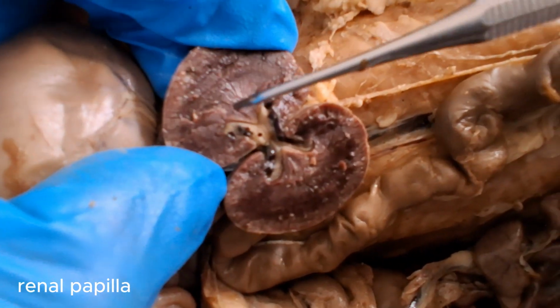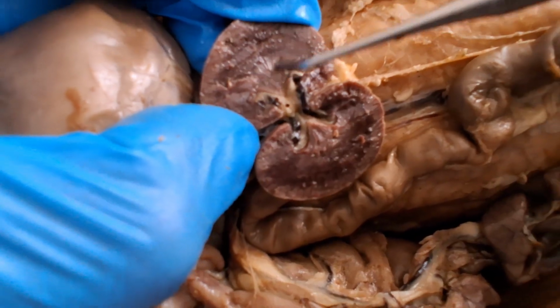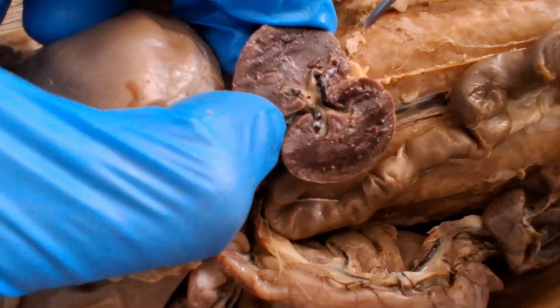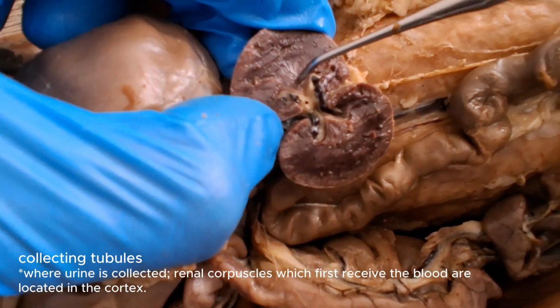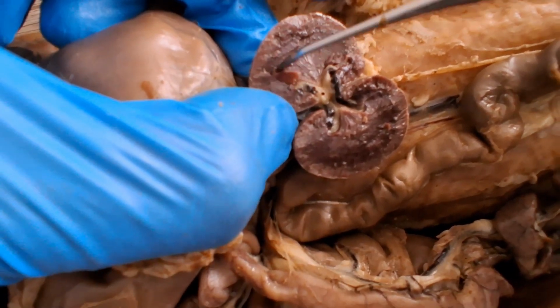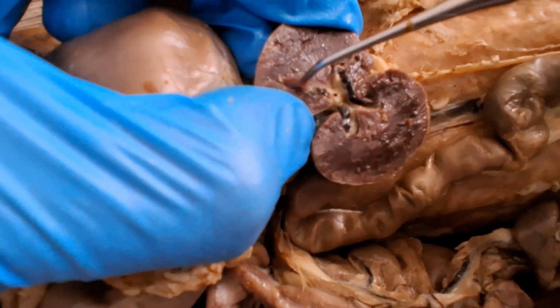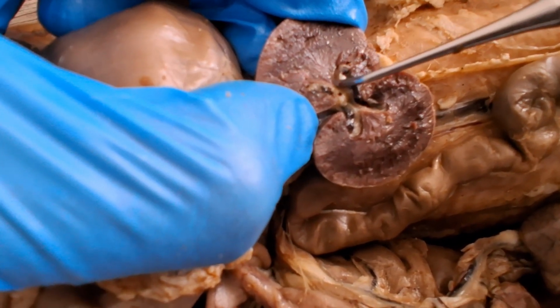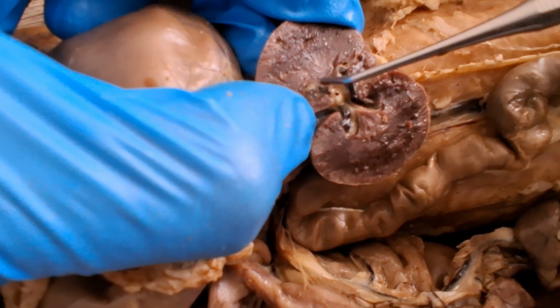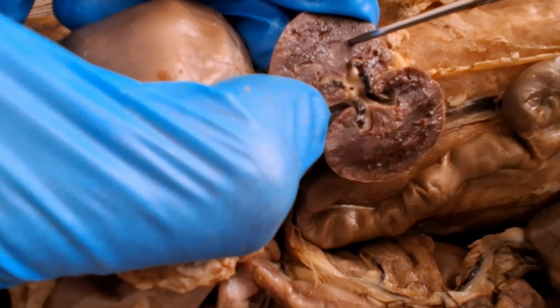I don't know if you can see, there are white streaks there in the renal medulla. If you look microscopically, those would be the location of the collecting tubules, collecting all the urine from the microscopic nephrons here. So those white streaks are the collecting tubules, and all of them converge at the renal papilla, the pointy end. Together, the collecting tubules and the renal papilla compose a renal pyramid.